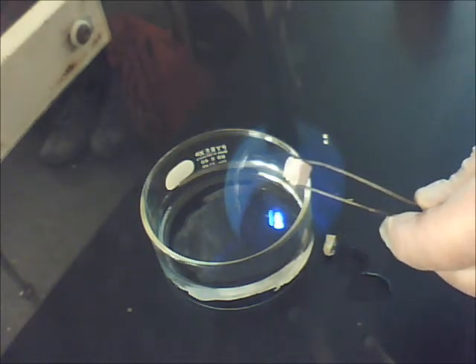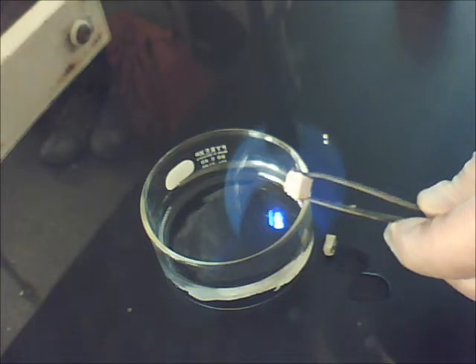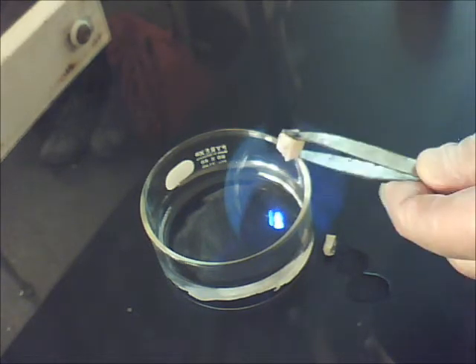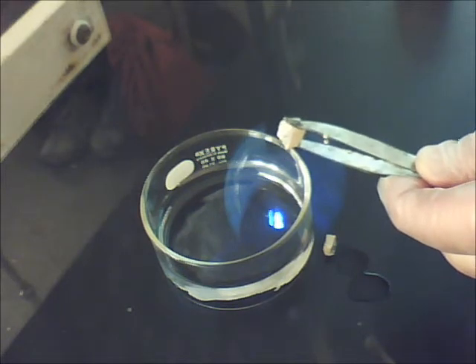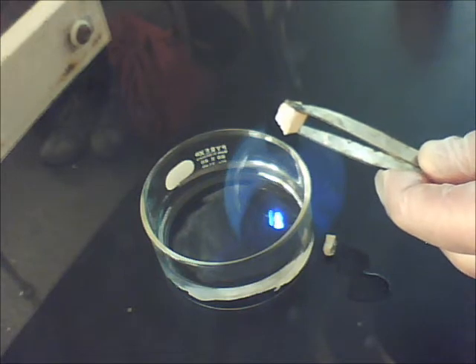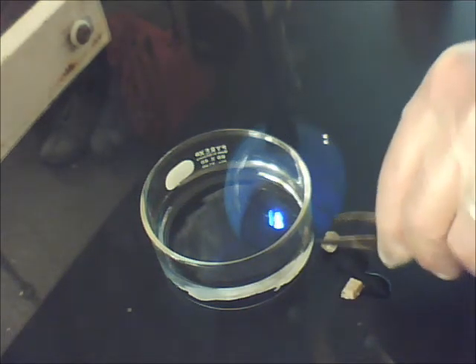That's a very soft metal, so I can just cut it with a knife. Okay? And now you can see that there's a shiny inside. Not really. Yeah, I can't see. Where that spot is, move over to the right. Because it's like reflecting the camera. Yeah. You see it? It's like a blue. That little blue circle. You move it up a little bit. There you go. Okay? All right. So I want to take and put this back in my bottle and safely put it away.